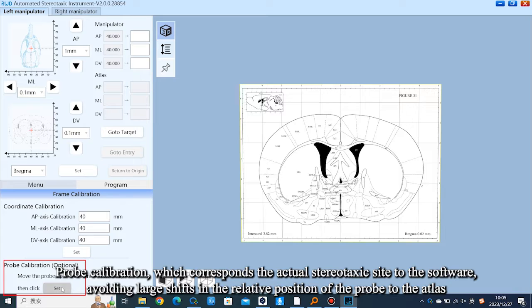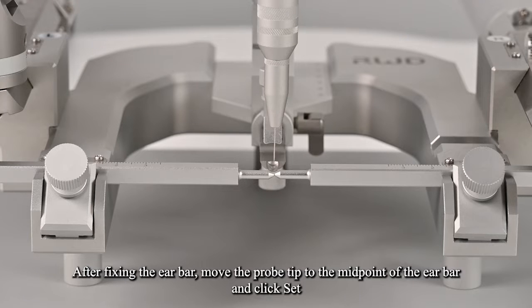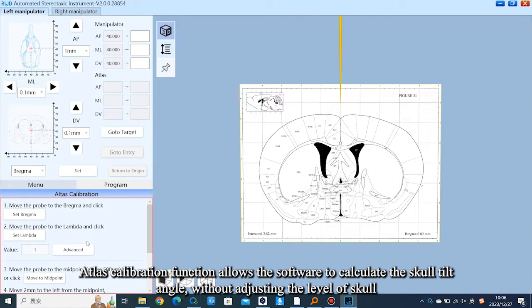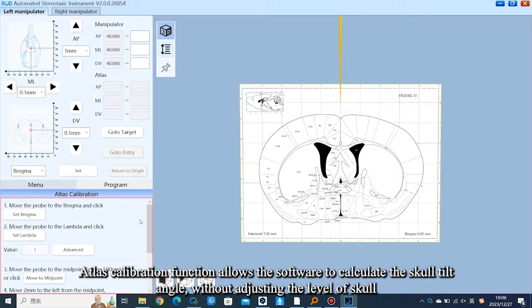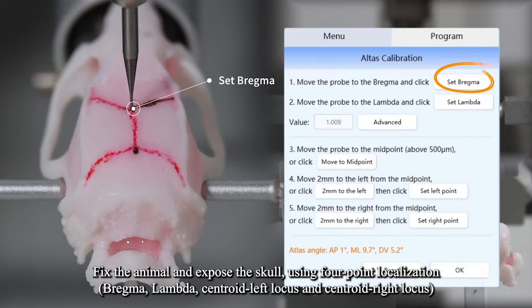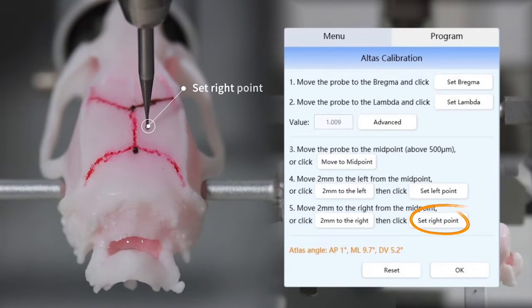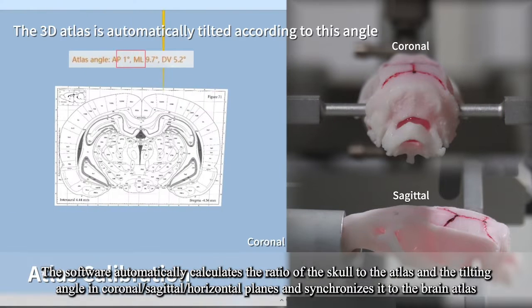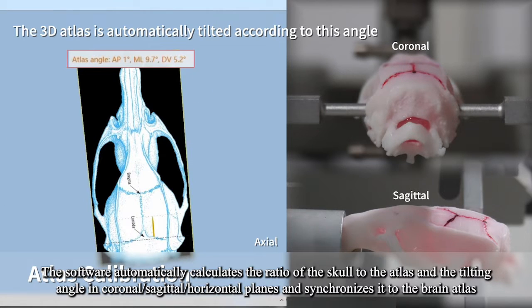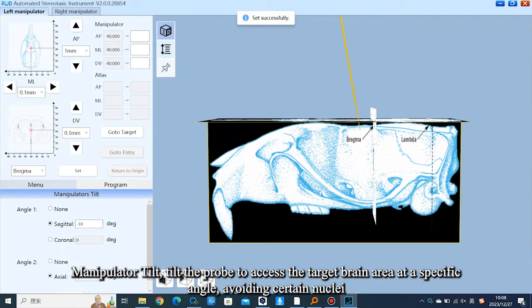Probe calibration corresponds the actual stereotaxic site to the software, avoiding large shifts in the relative position of the probe to the ATLAS. After fixing the ear bar, move the probe tip to the midpoint of the ear bar and click Set. The ATLAS calibration function allows the software to calculate the skull tilt angle without manually adjusting the level of the skull. Fix the animal and expose the skull using four-point localization: bregma, lambda, centroid left locus, and centroid right locus. Following the instructions, move the probe and when it touches the skull, click Set. The software automatically calculates the ratio of the skull to the ATLAS, and the tilting angles in the coronal, sagittal, and horizontal planes, then synchronizes it to the Brain ATLAS. Manipulator tilt allows tilting the probe to access the target brain area at a specific angle, avoiding certain nuclei.